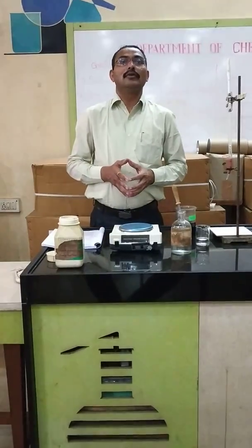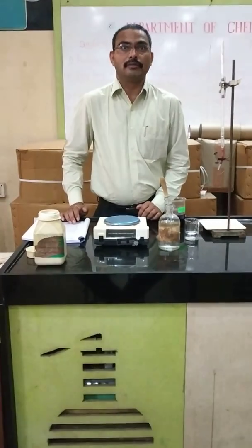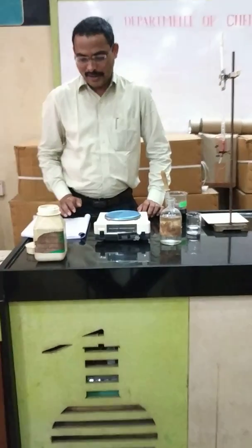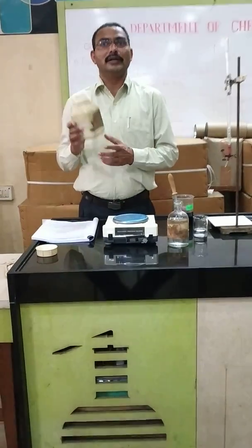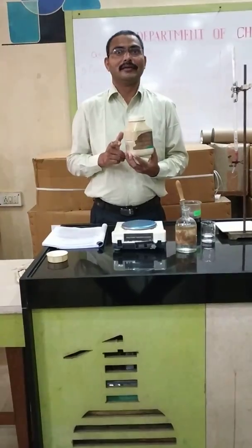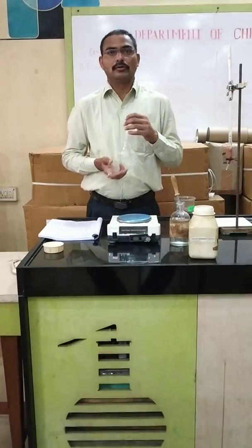You know that molarity and normality are units used to express concentration. For this experiment we have to prepare 0.1 molar Mohr's salt, that is ferrous ammonium sulfate. Ferrous ammonium sulfate has a molecular weight of 392 grams. When 392 grams of ferrous ammonium sulfate is dissolved in one liter, that is called a one molar solution. But we require only 100 ml solution.